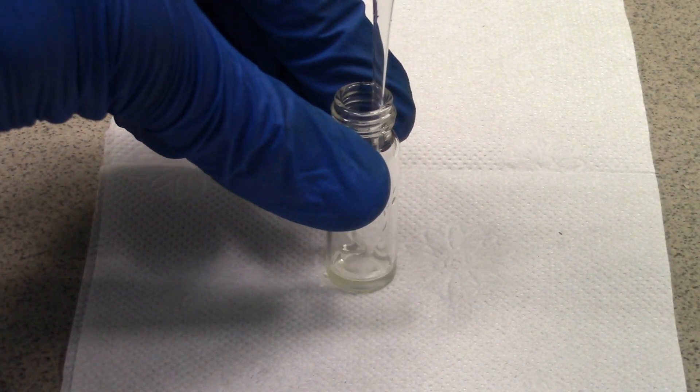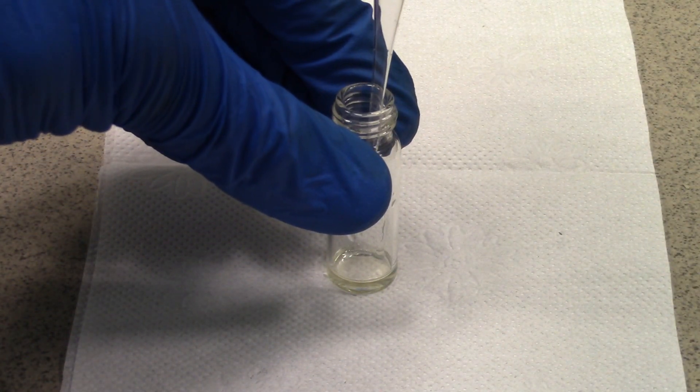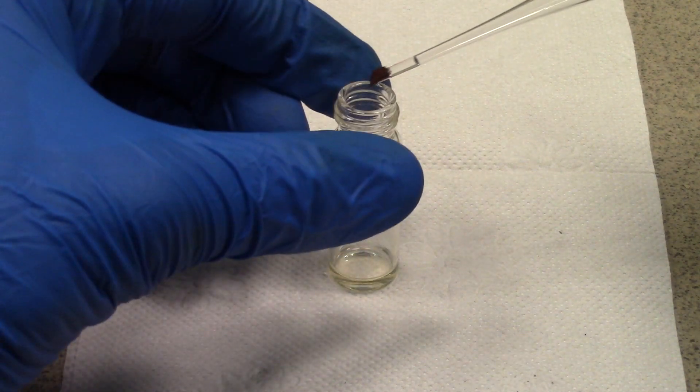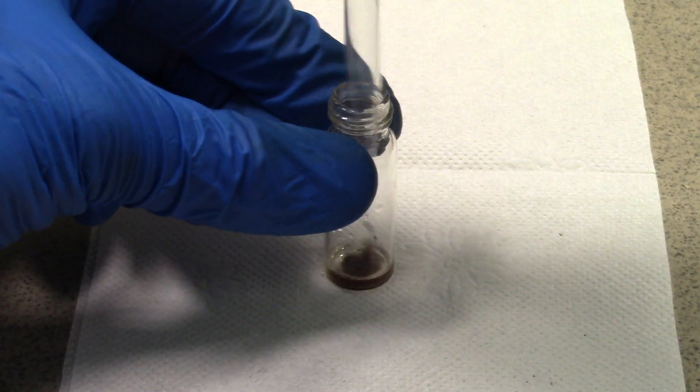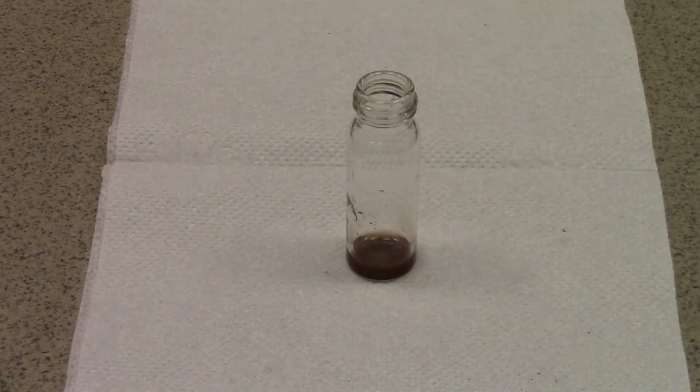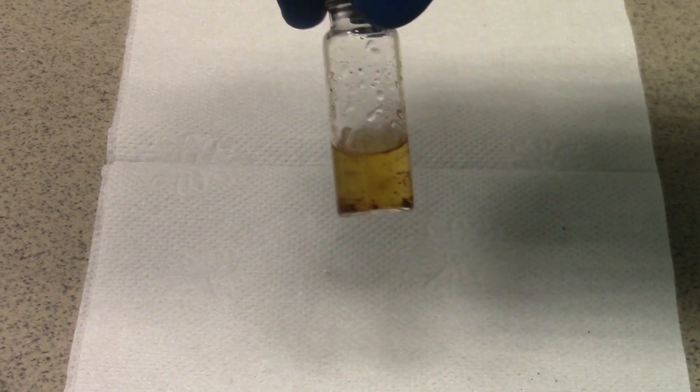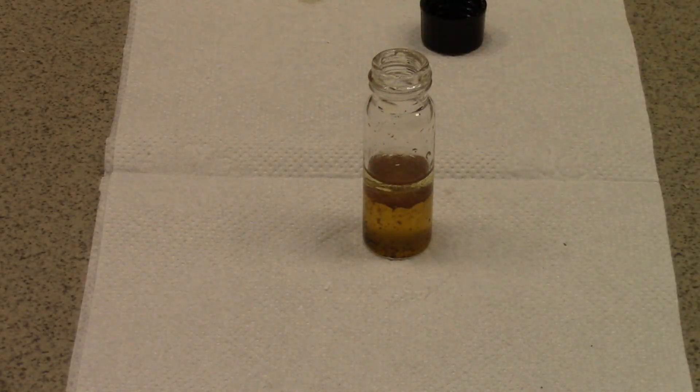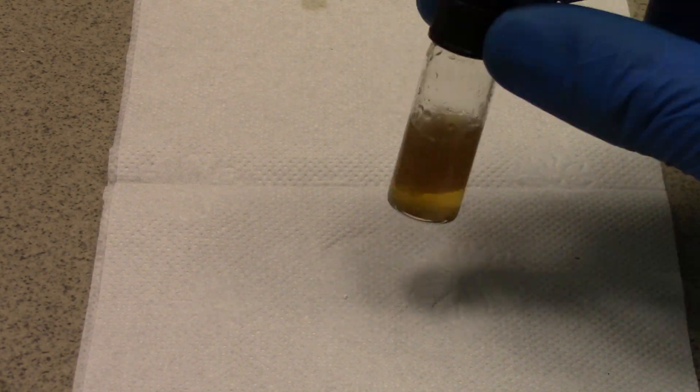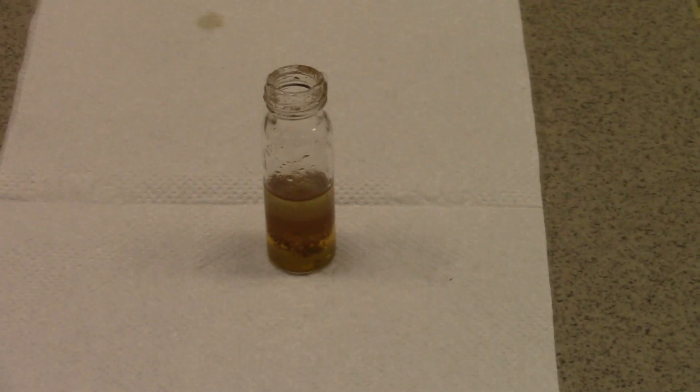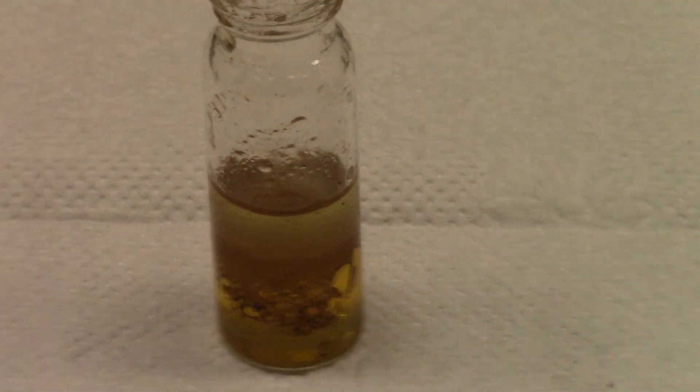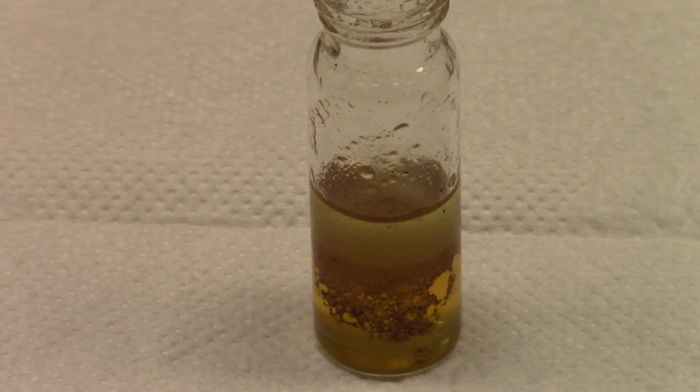Second test isn't as demonstrative, but I have made it. I put a small grain of palladium dichloride in concentrated hydrochloric acid and added remaining DBD. As you can see, the bottom layer becomes darker, but dibutyl diglyme is still a little bit yellowish as it was.